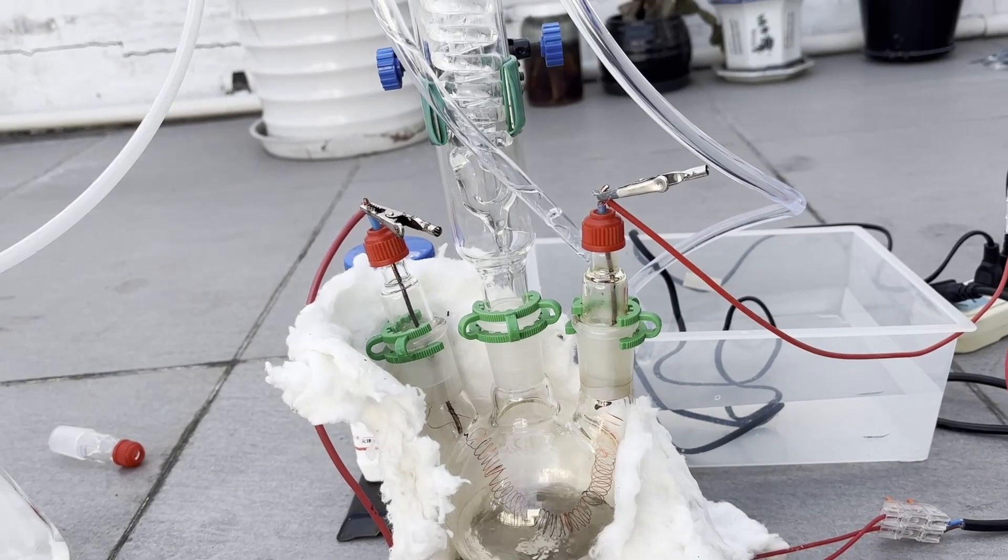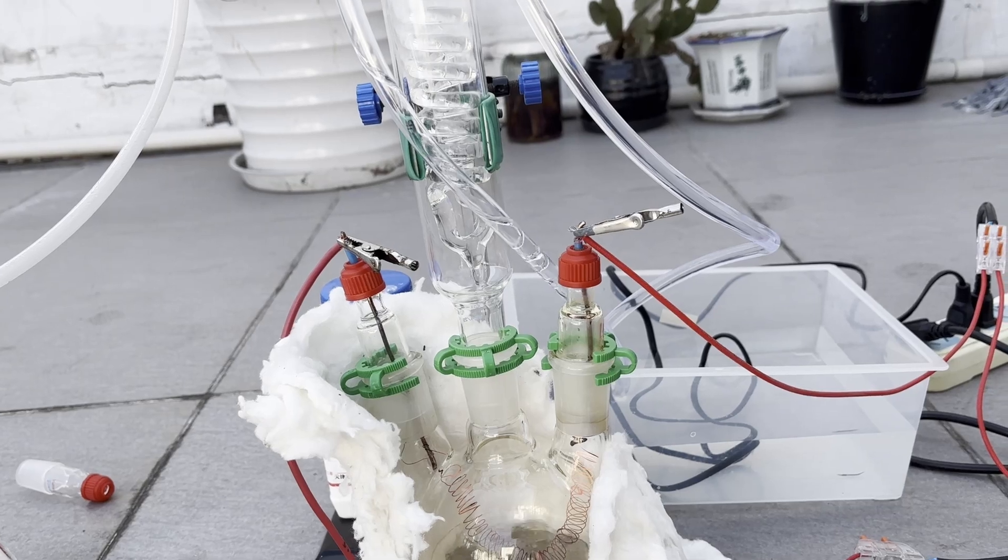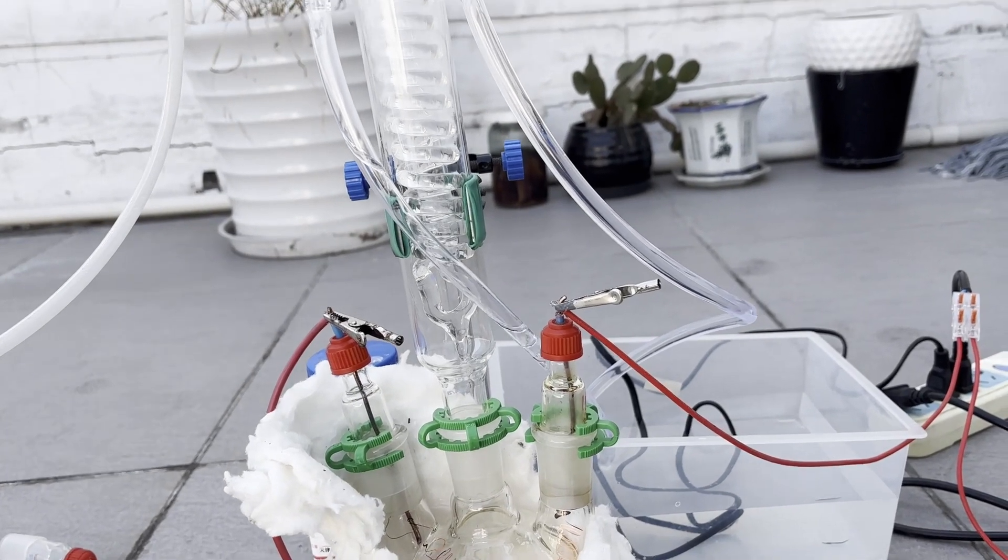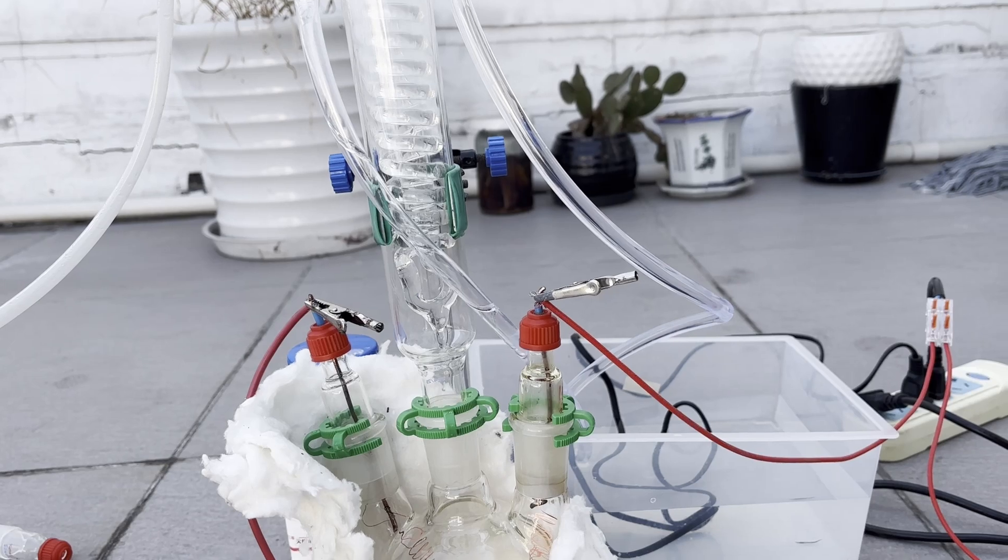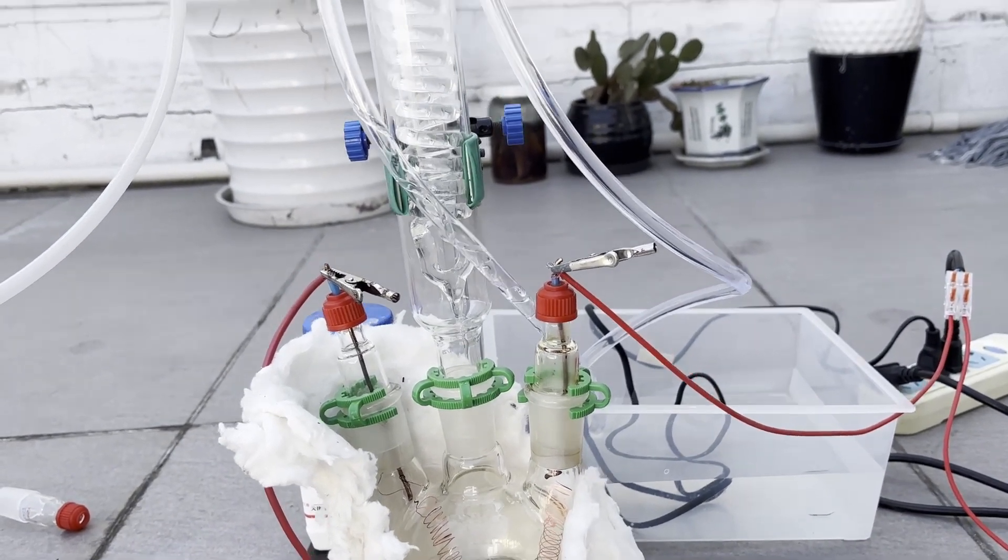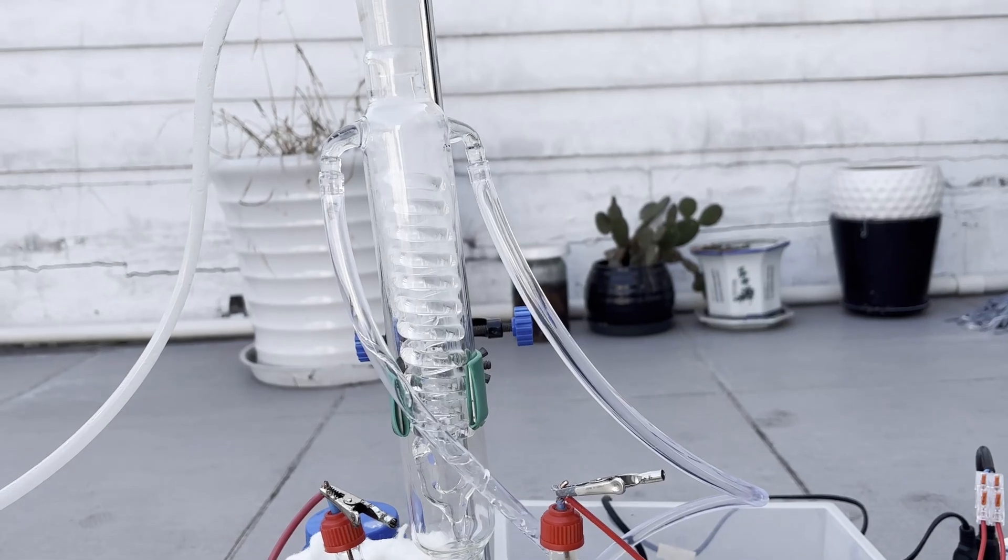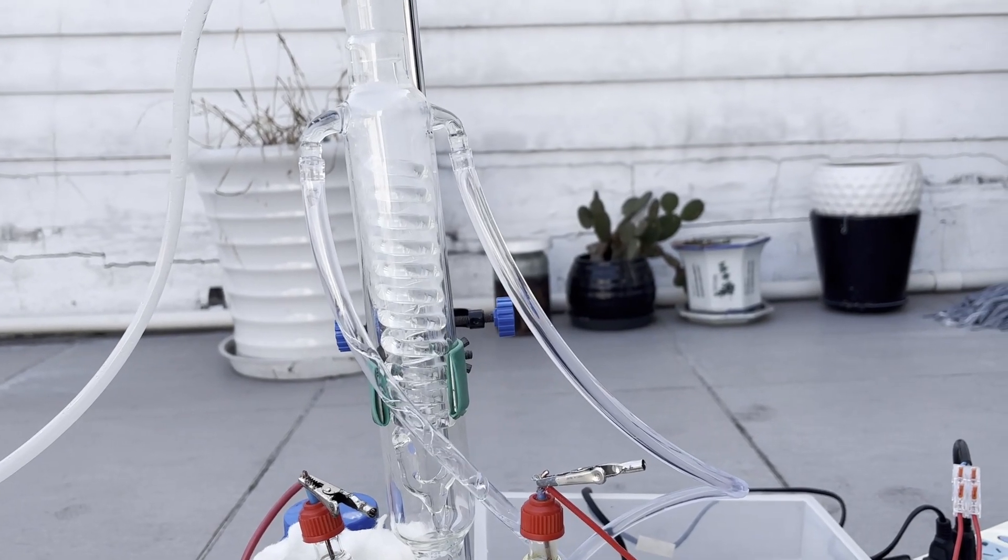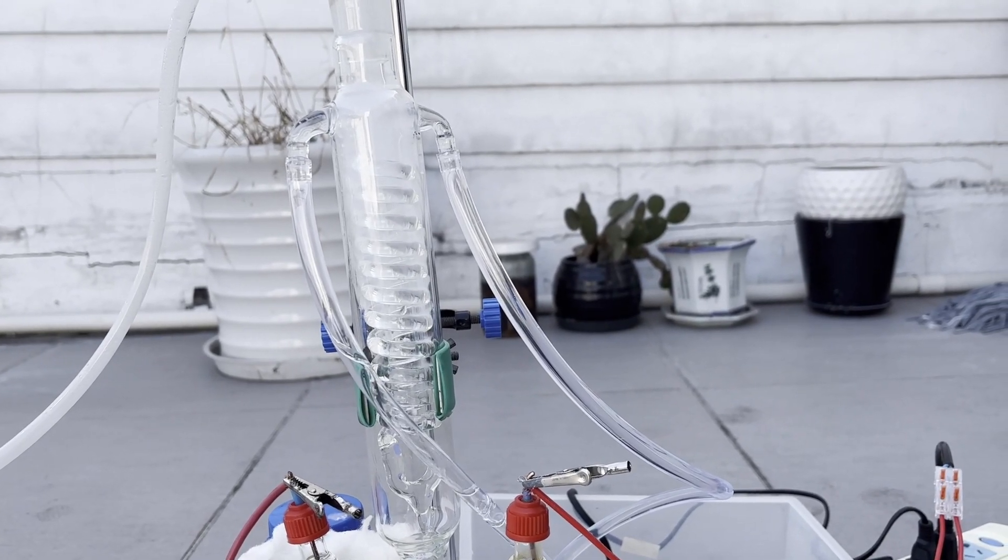Hi guys, here is MIH. Since when I've started doing organic chemistry, the two main types of chemicals I have to get my hands on are solvents and dehydrating agents. Needless to say, having an array of solvents is essential as most organic reactions and purification procedures rely on the distinctive properties of the solvents.